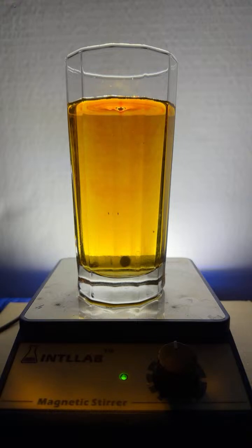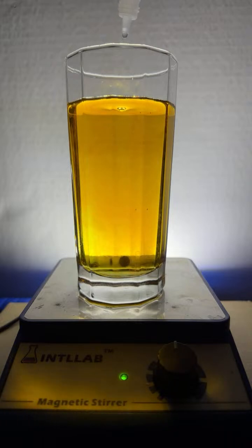I agree, Riker. I'm going to add another drop of the... hey, wait a minute. I thought this was a green dye. I haven't seen green yet. All I've seen is orange and yellow. Let's add some acid, see if we can develop the green. I don't know what's going on here. There's 2 drops of acid. There's 3.